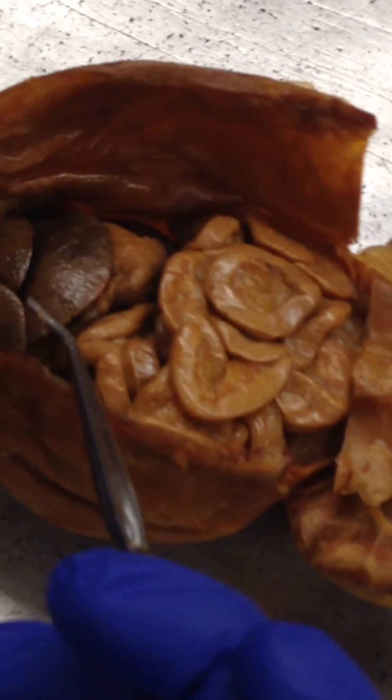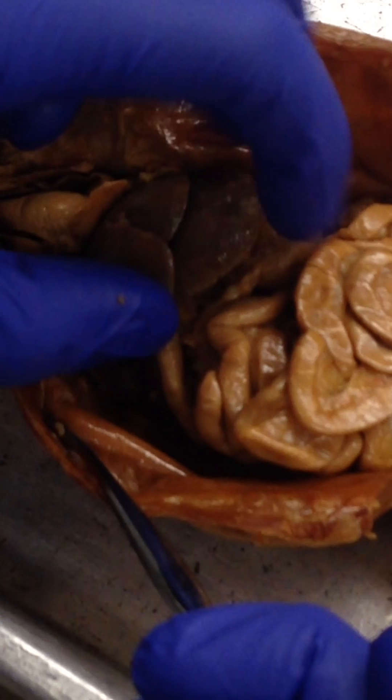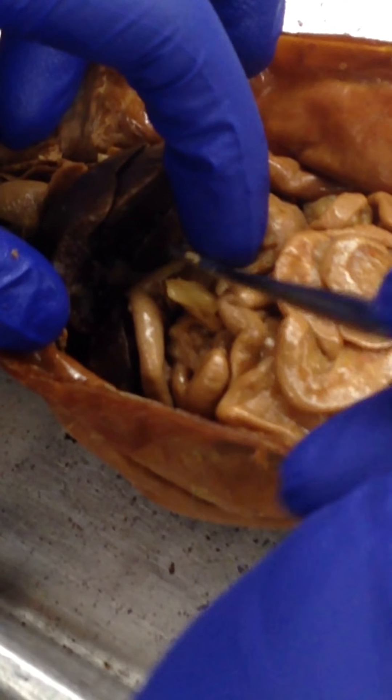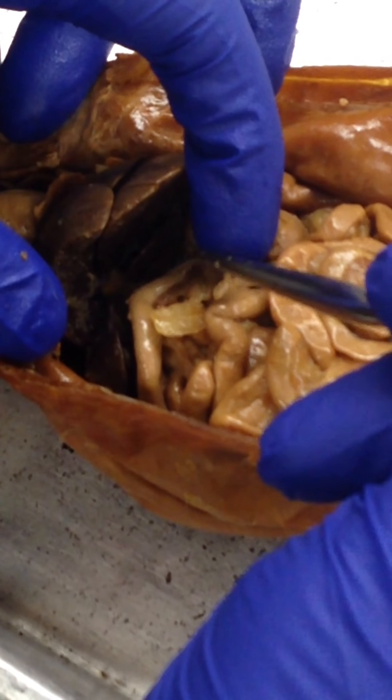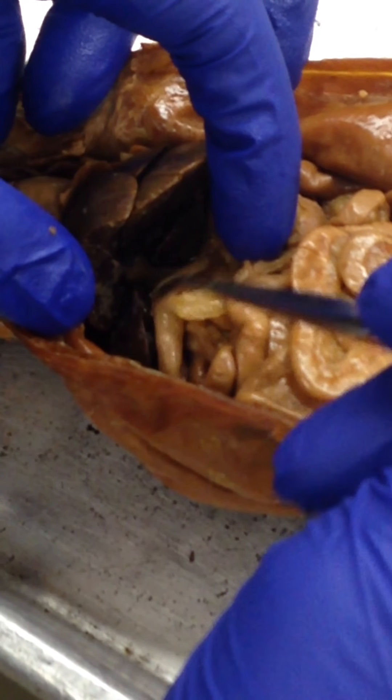The duodenum is the first part of the small intestine, so it's right here. It's the light-colored part.